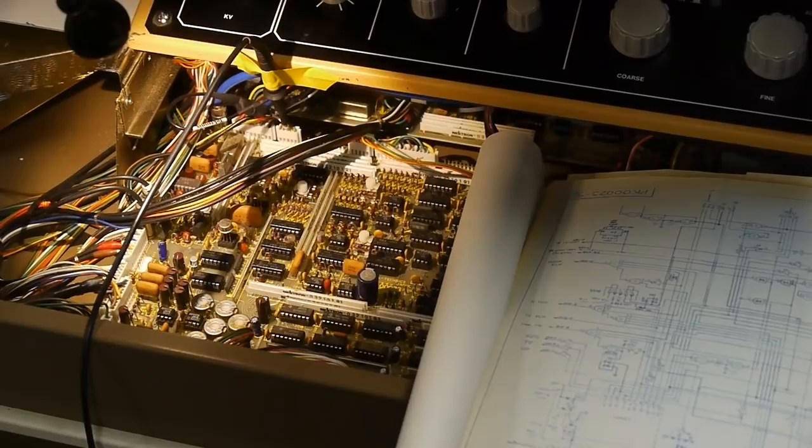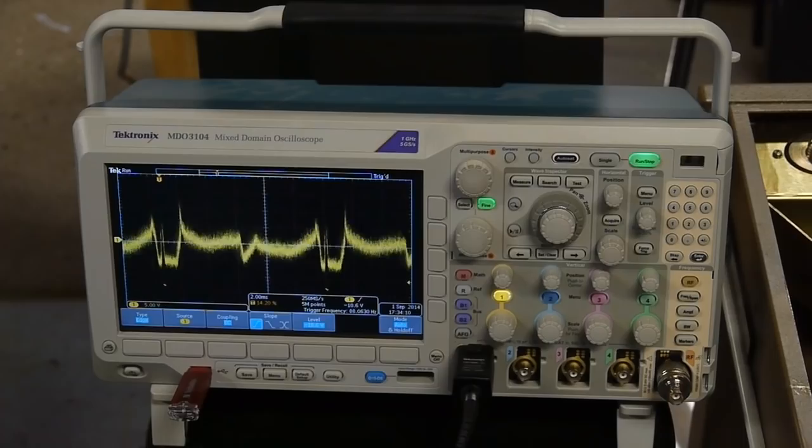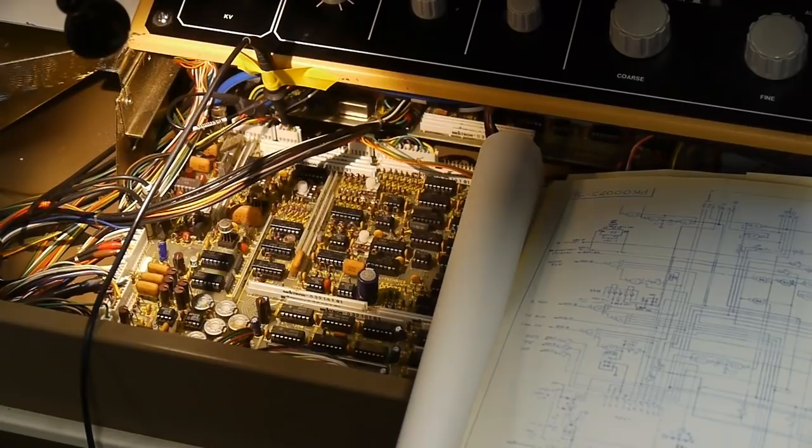So lucky for me, I have nearly the complete schematic for the whole scanning electron microscope and probed the board at the point where I get the video signal for these slow 10 and 60 second scan readouts. The signal is quite high amplitude, we're at 5 volts per division.